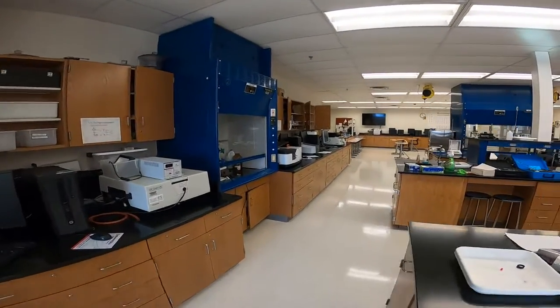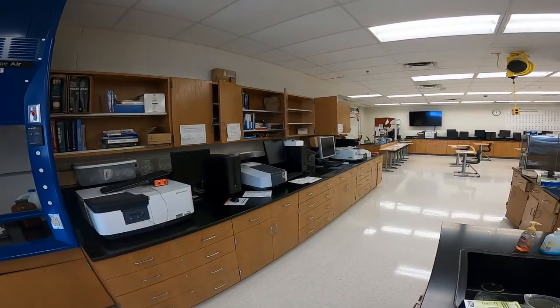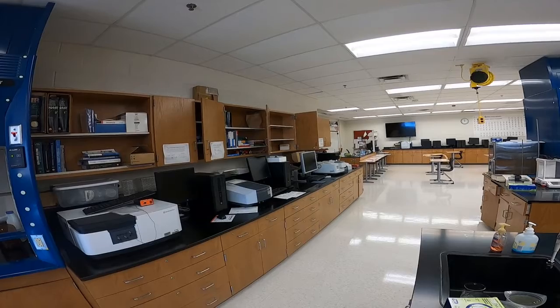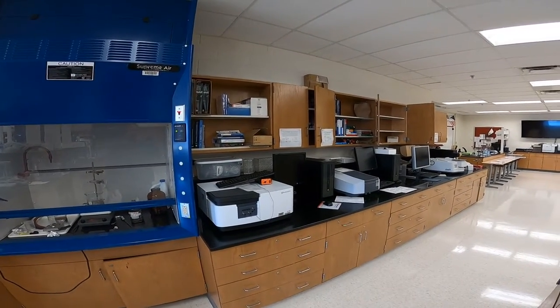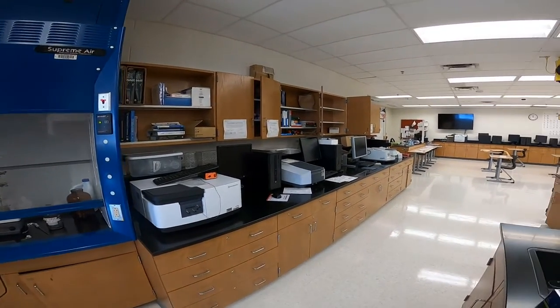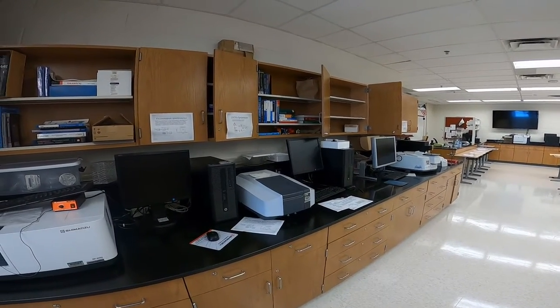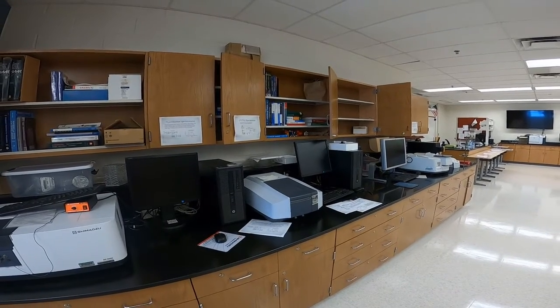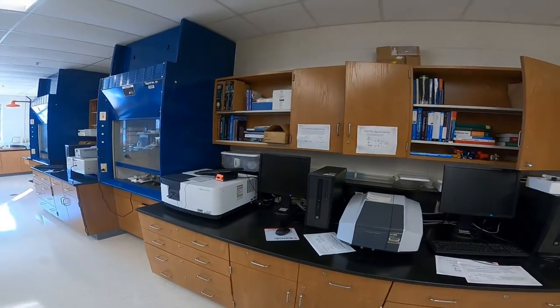And over here we have a variety of spectroscopy instruments, and commonly spectroscopy uses some form of light or energy to measure properties of molecules. The two things over here are a fluorescent spectrometer that can be used to measure the fluorescent properties of molecules, and then we have what's called a UV vis spectrometer. So with that you can measure the ability for a molecule to absorb ultraviolet radiation or visible light radiation. So those most commonly are used to do quantitative analysis.